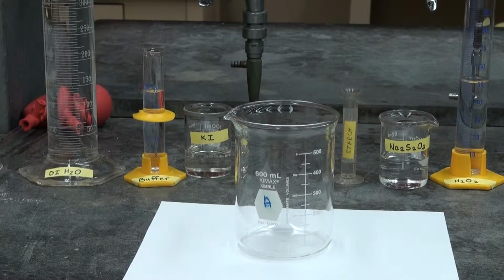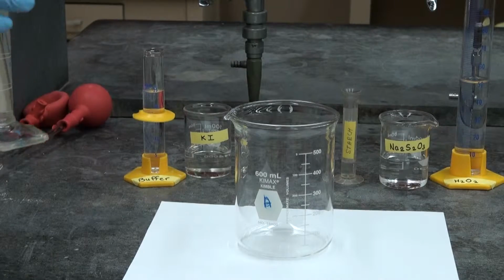In this lab, we can do a chemical kinetics experiment. What we will do is, in the 600 ml beaker, we will prepare a mixture of chemicals which after a certain amount of time will change color because of a chemical reaction. The mixture of chemicals that we will place into the beaker is made up of some chemicals for which the volumes aren't all that accurate and some which are accurate.